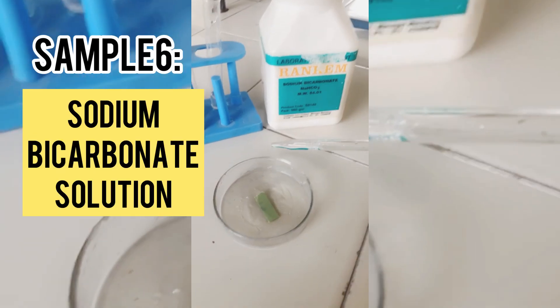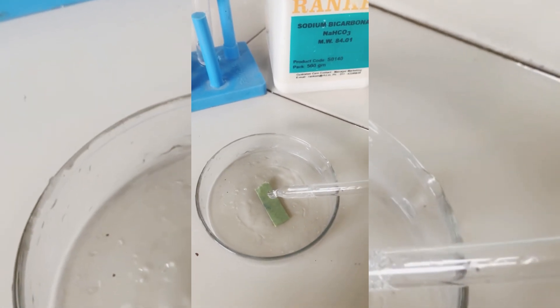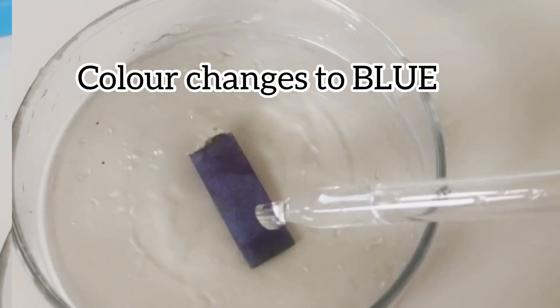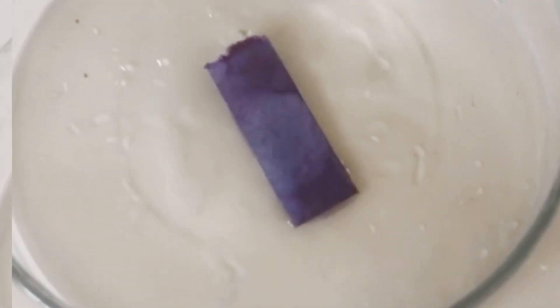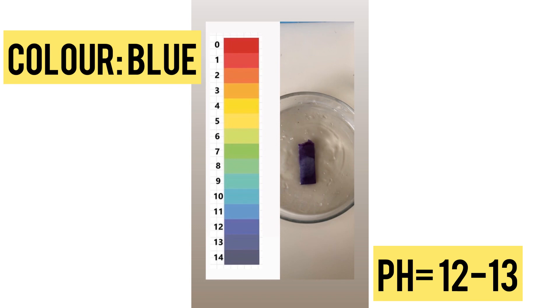Next sample is sodium bicarbonate. It is a salt of a strong base and weak acid. You can see the color is changing to blue. That corresponds to pH 12 to 13.